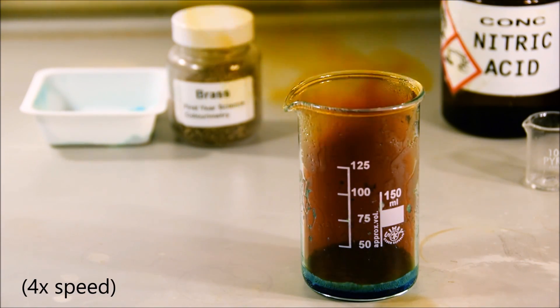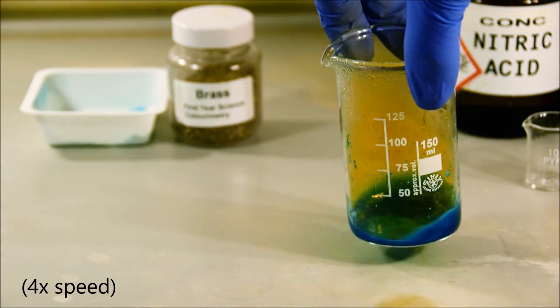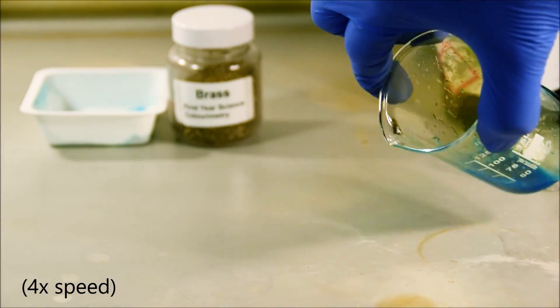Suffice it to say, do not try this at home. That brown gas is highly toxic and this reaction is being carried out in an efficient fume hood with all the requisite safety equipment.